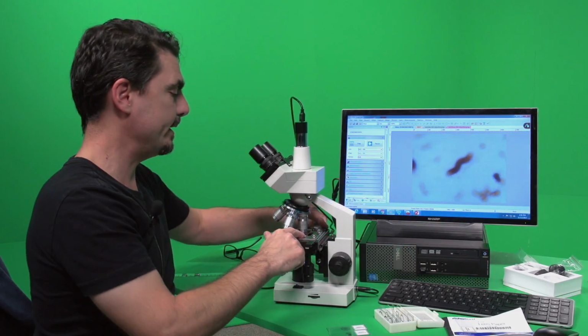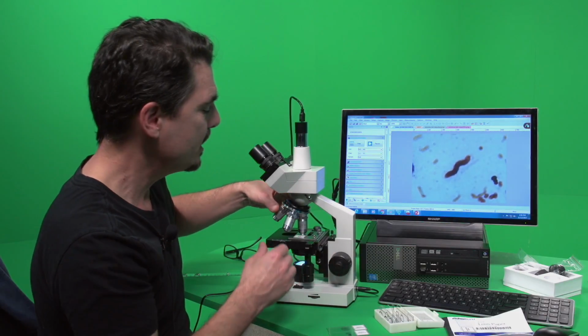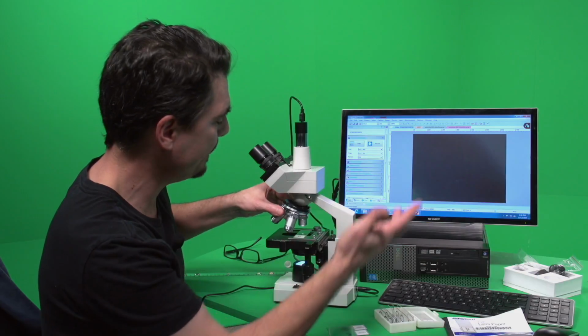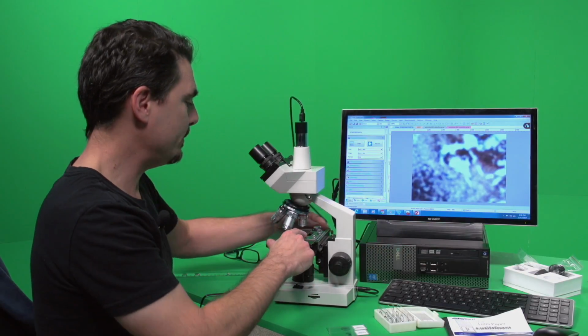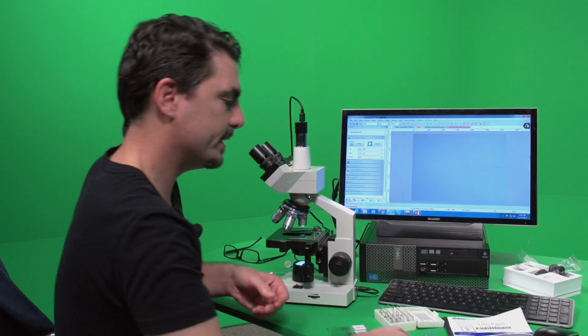So let's go ahead and I'll show you a little bit. Well, nope, let's go through the steps. So what we can do then is we can go move this. We're done with that. So I took the picture, uploaded it. When we're done with the slide with the oil, I may want to look at this again, so I'm just going to put this to the side.